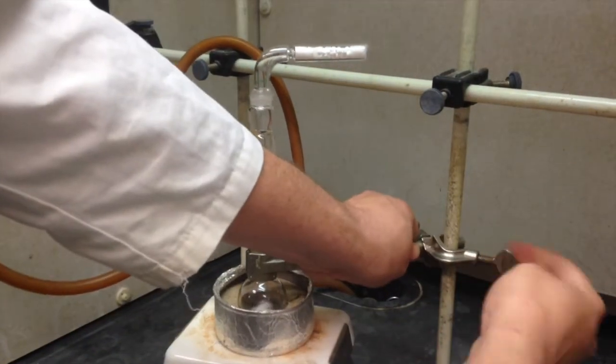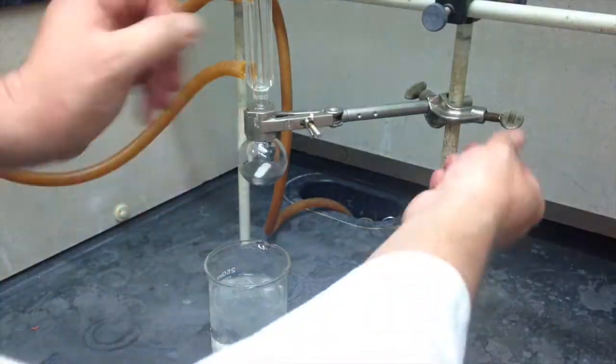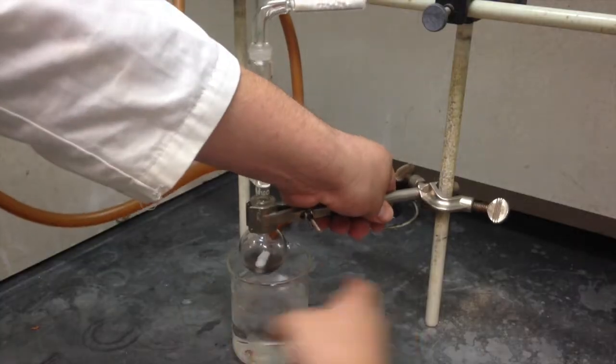While it's cooking, go grab yourself an ice bath. After it's done, loosen the back bolt, lift it up, take out the hot plate, and then lower it into the ice bath.